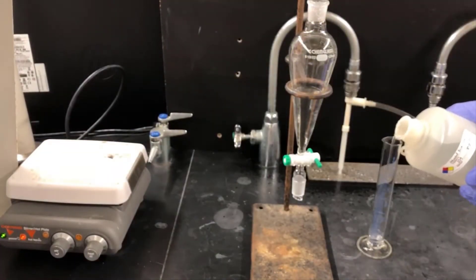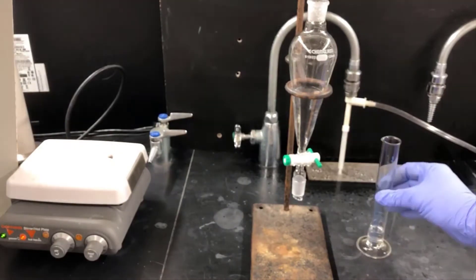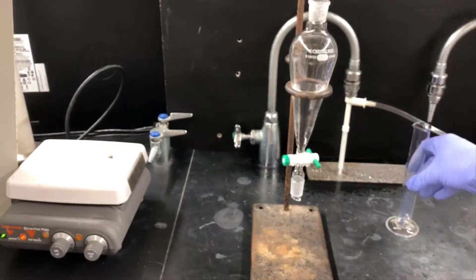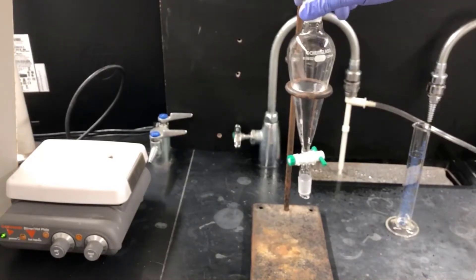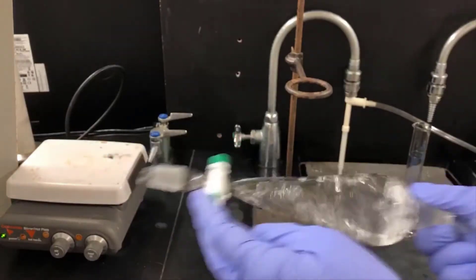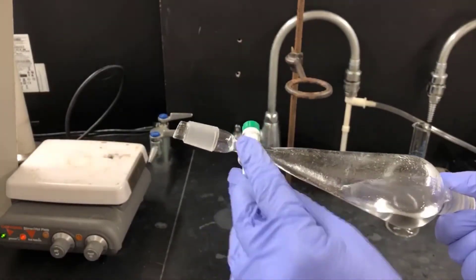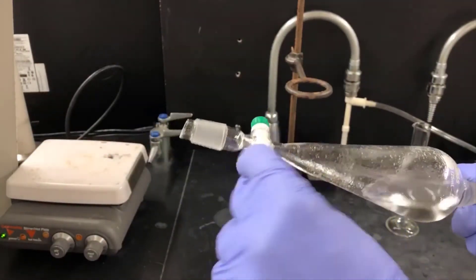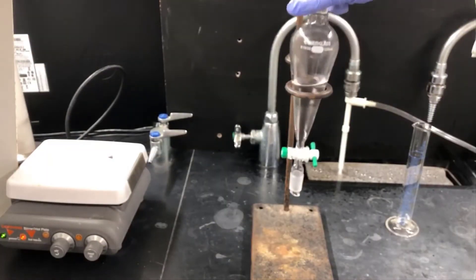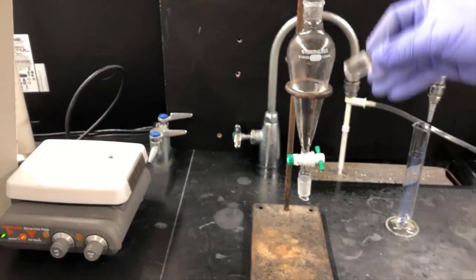Water has a density of 1 gram per milliliter, and ethyl acetate has a density of 0.9 grams per milliliter. They're very close. This sometimes makes it difficult for water droplets to separate out of ethyl acetate. Brine is more dense than water. Its density is 1.2 grams per milliliter. By adding brine and shaking, I'll make any suspended water droplets much more dense and much more likely to settle out into the water layer and get drained off. This is a method for clarifying organic layers.